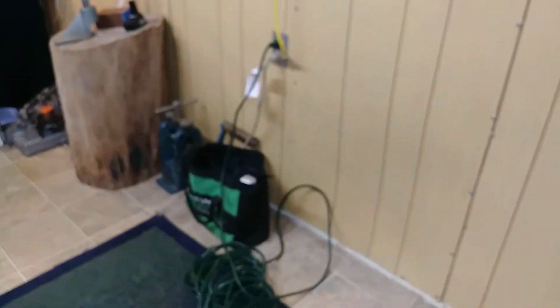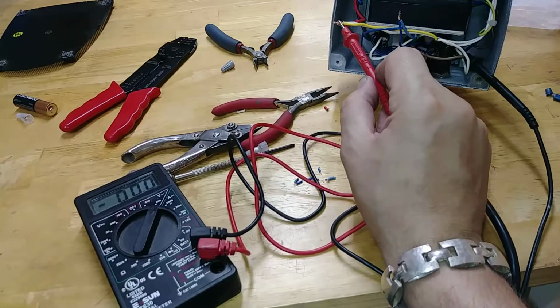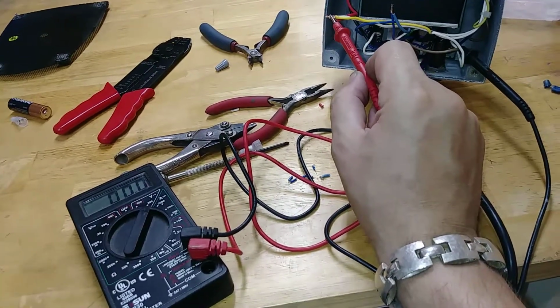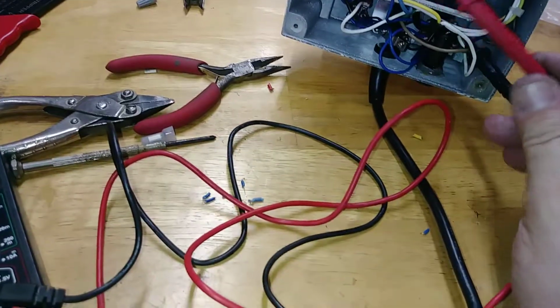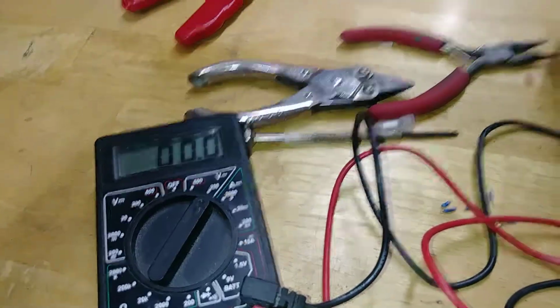You do verify that this is actual alternating current. You see that, right? And it is plugged into the wall. Okay? This is not a prank. Touch it, right? You've got to have the lead on it. Basically, you get my point. You've got to have the lead touching there, and then you see voltage.